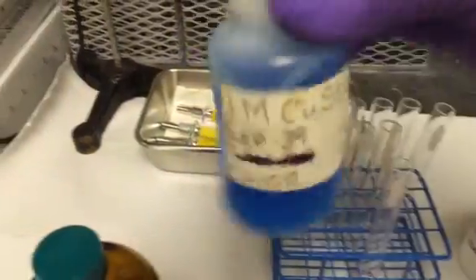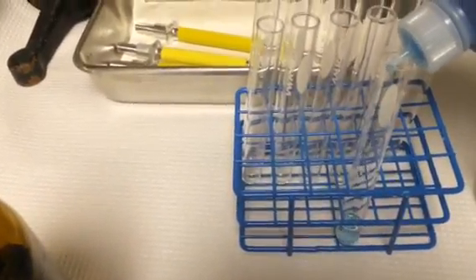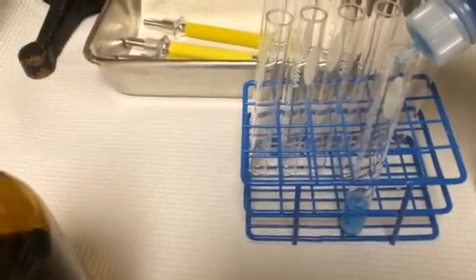You're going to check — that's good. Ready? And this one is the copper sulfate; that's what the color looks like. I'm ready — let's pour this into the tube and mix it in. Let's see how it's going.